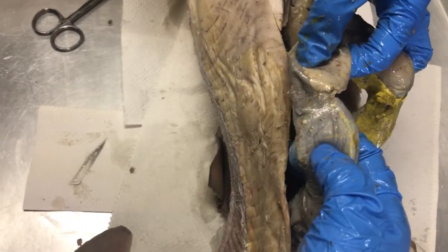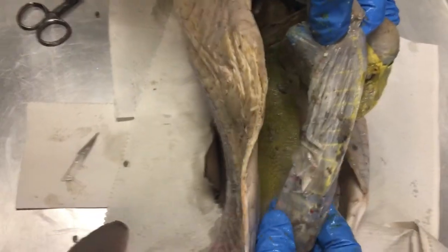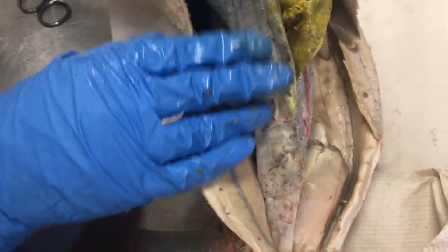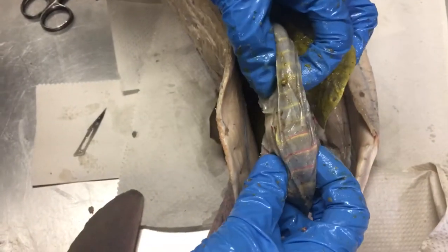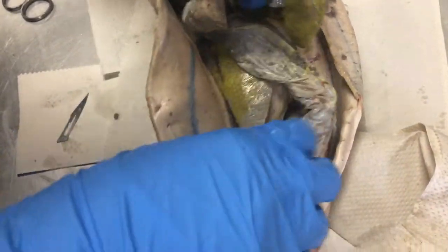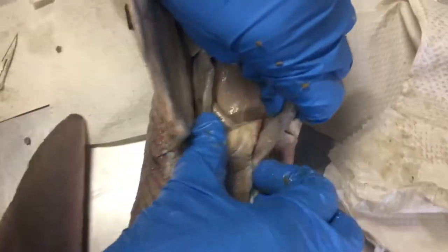The duodenum is this section between my fingers, and then you go down and see the ileum — that's all of this small intestine — and as you can see, it has a spiral valve. That's really clear to see.